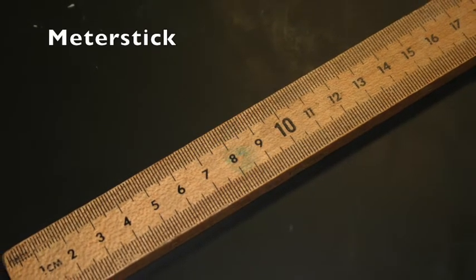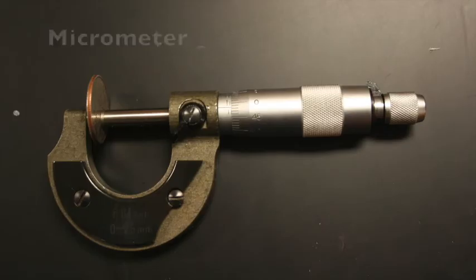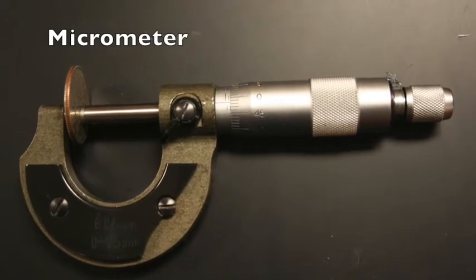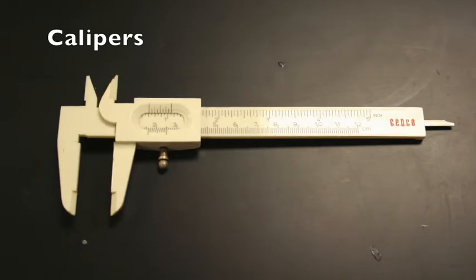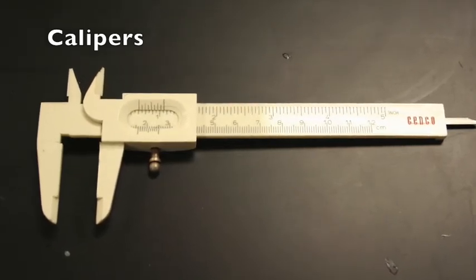It is appropriately called a meter stick and is used to measure distance. The micrometer also measures distance, but can do so on a much smaller scale. The calipers can be used to measure distance across odd-shaped objects and also the internal diameter of a cylinder.